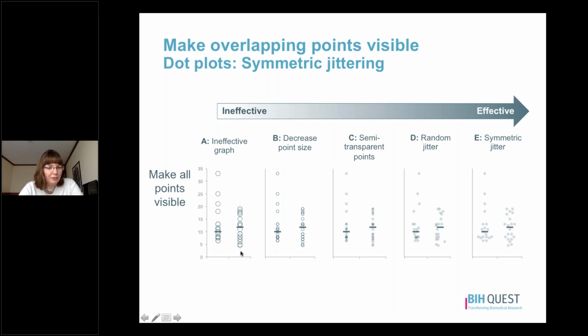In our ineffective graph, we have a simple strip plot. The data points are on top of each other. We can't really tell how many data points are in these very dense regions, which makes it a little bit complicated to determine what the data distribution might be. One strategy we could use would be to decrease the point size slightly. We don't want it to be too small because then it's hard to see the data points. But in this particular data set, that doesn't really help us very much. These data points are still overlapping.